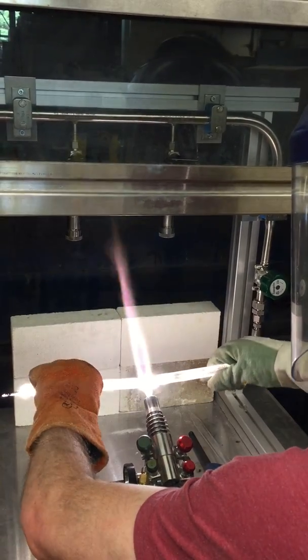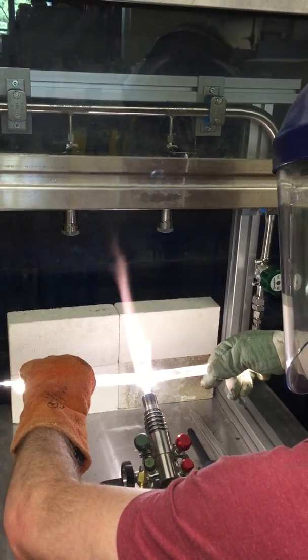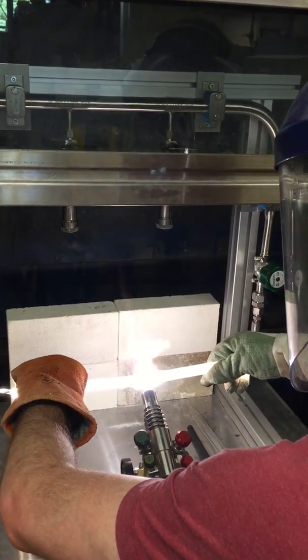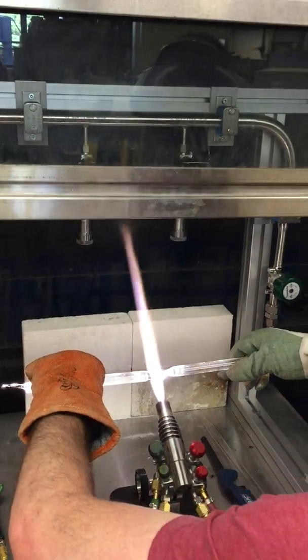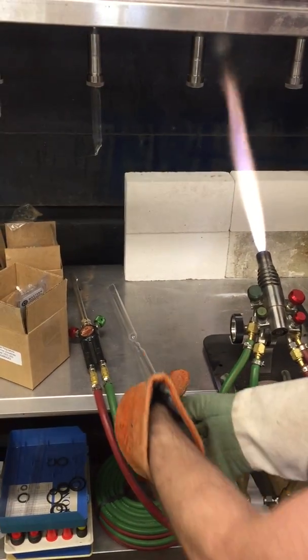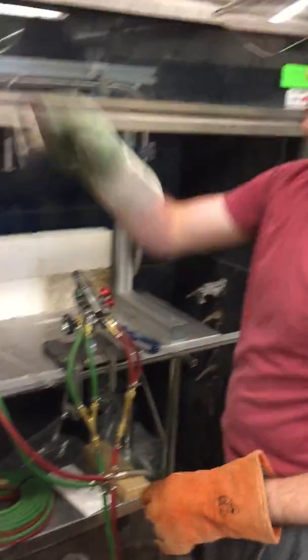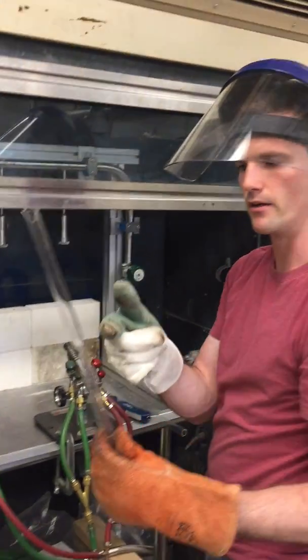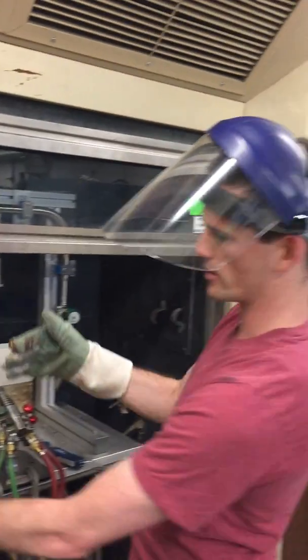Once it's like — get a neck in there that's pretty small. Once you get a neck that's like that small and it can support its own weight, let it cool up and then you can shut off the gas. At this point it could be a little fragile there, but you want to stick the loose end — hopefully you do it a little bit shorter so it'll actually fit in here.